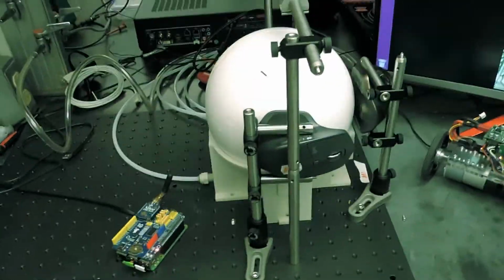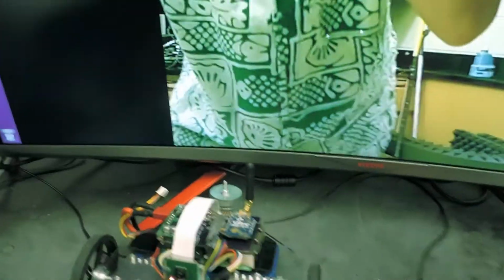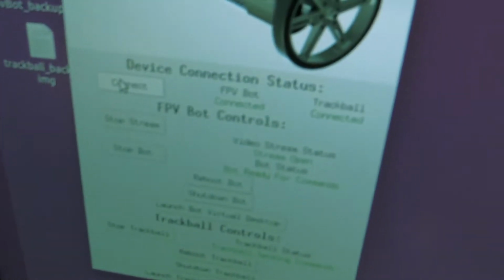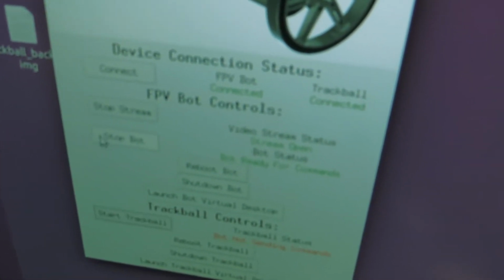So once we're done with the video stream, or with the whole testing process rather, there's a Ubuntu PC that kind of pulls all the data together. So we can turn off the trackball, the robot, and the video stream. And now all this data is pulled onto a separate hard drive.